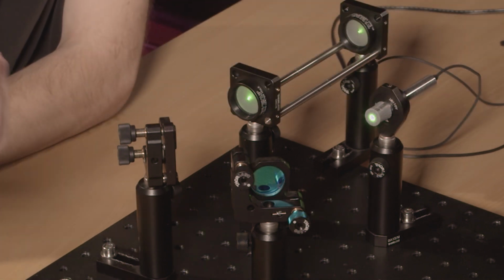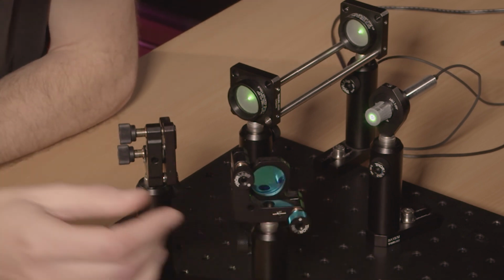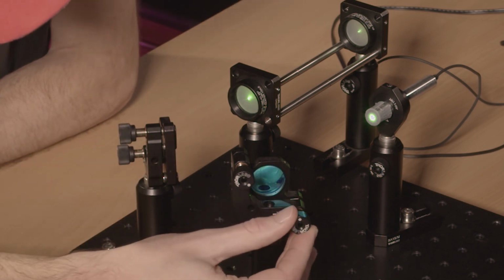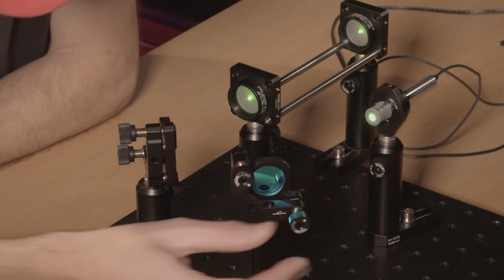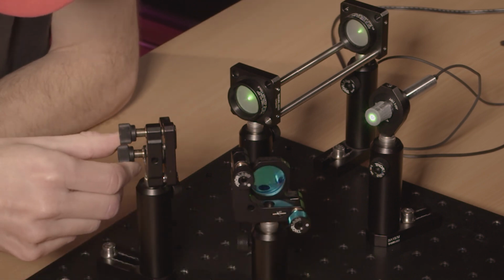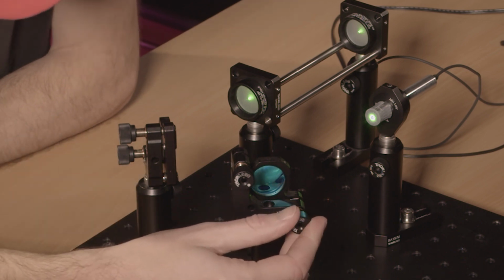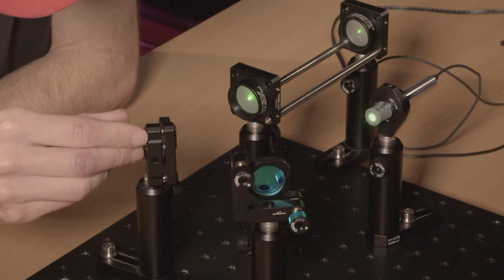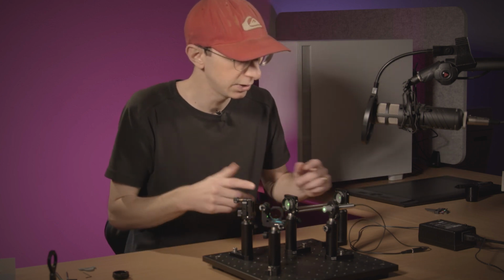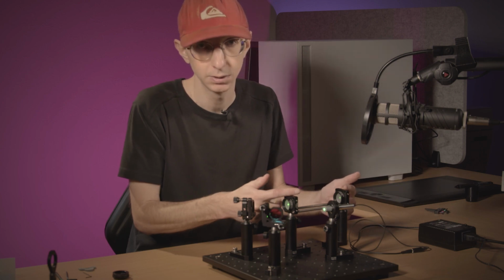It will restrict the beam diameter and now we can clearly see a very nice beam. Now it's centered here. We are perfect on the second, small adjustments on this one. And that's it. So we now have a laser beam that is exactly going through these two apertures. So we have a laser that's aligned with the mechanical axis defined by the two apertures.